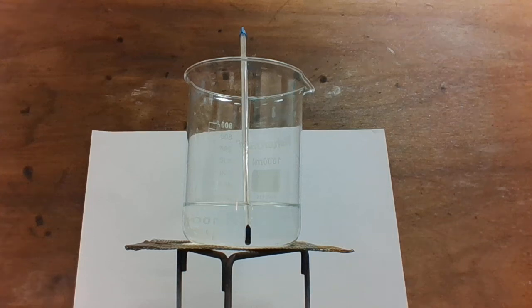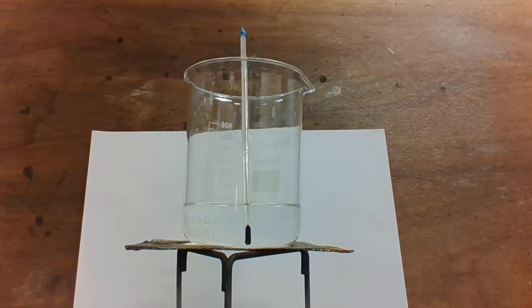This is a short demonstration to show how a catalyst increases the rate of a chemical reaction but remains chemically unchanged at the end.